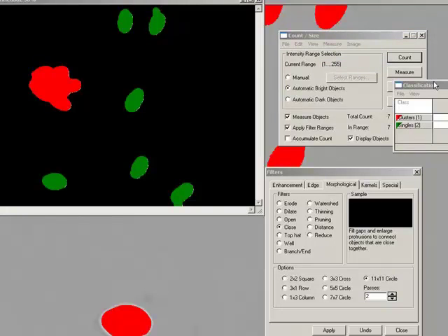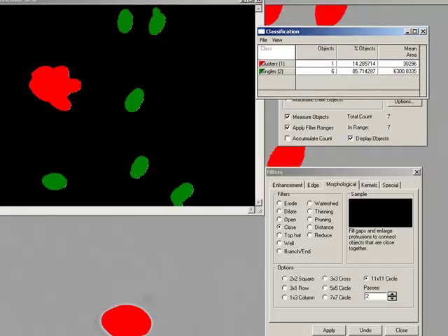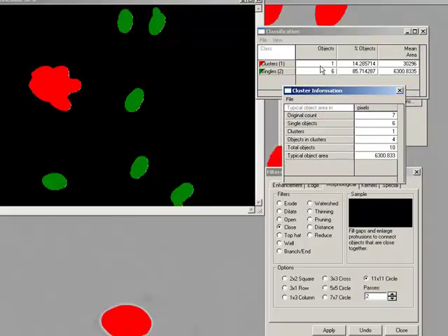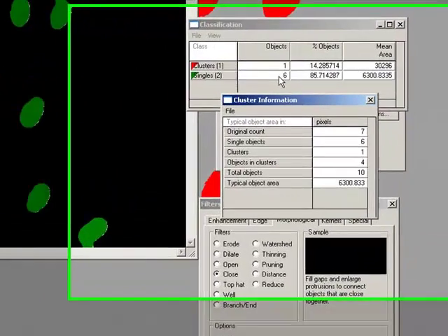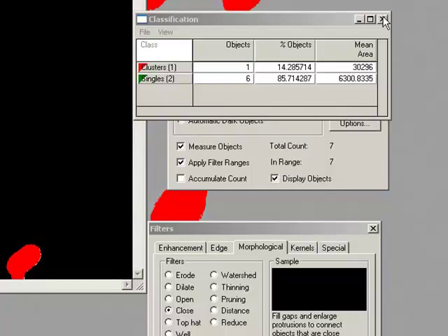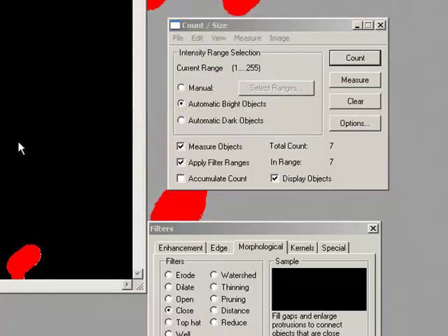So if I actually do some cluster analysis here, let me just bring these up. You can see that the cluster dialog tells me how many objects I have and how many were clusters. And you can read down here, objects in count 7, 6 of them are single, 1 of them is a cluster, and we believe 4 objects are inside the cluster. So we think there are actually 10 objects here. So this is quite a simple approach to using phase analysis. So this is one particular example.